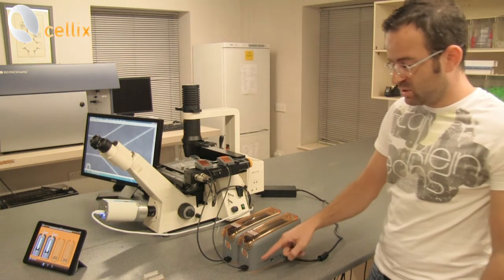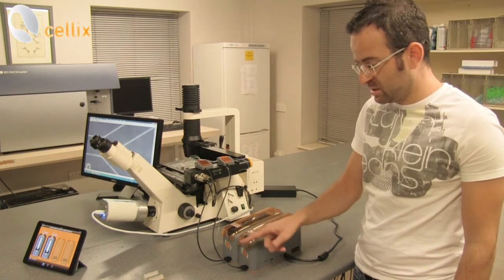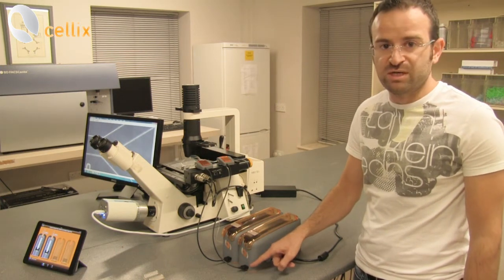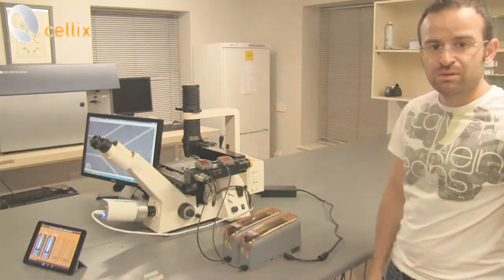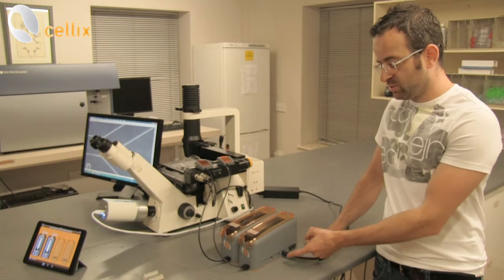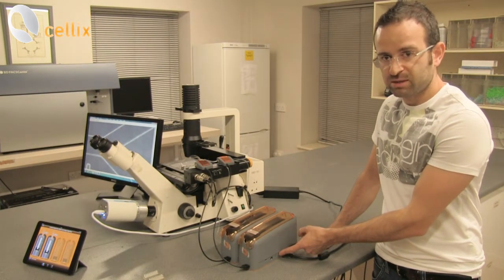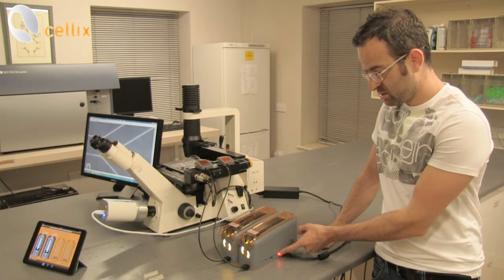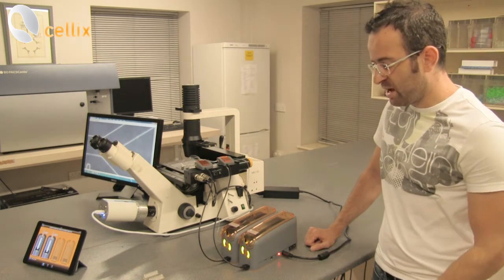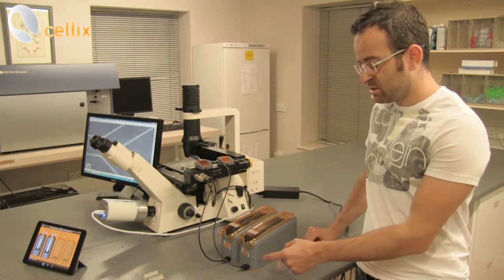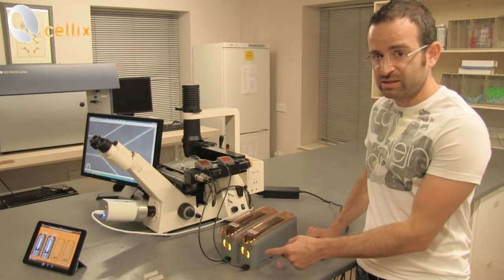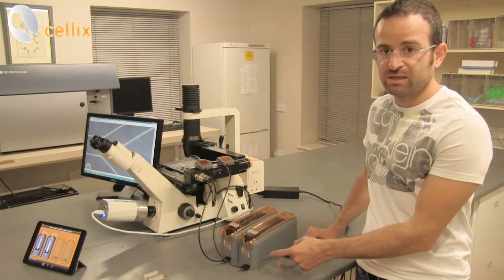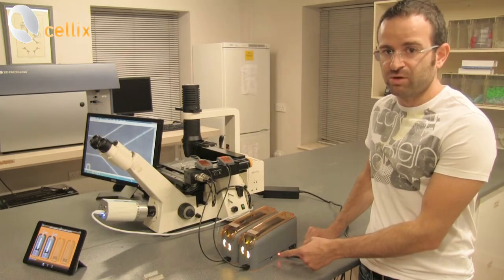We have also the sensors and the sensors are connected on the front side of the pump as we can see here. If we want to turn on the two pumps we just need to click this button here. As we can see we have LED lights in front so yellow light is fading and then it is flashing afterwards. This means that the pumps are plugged in correctly.